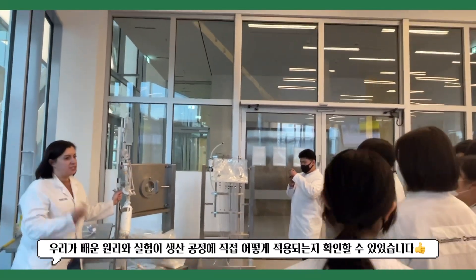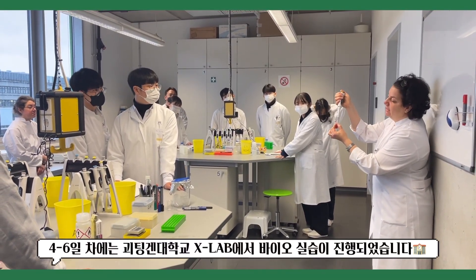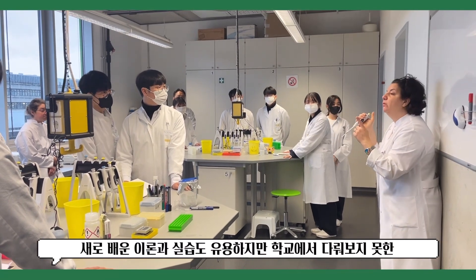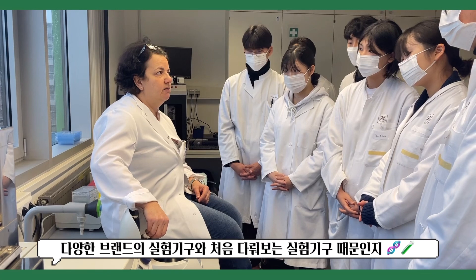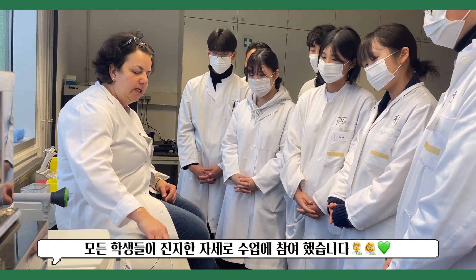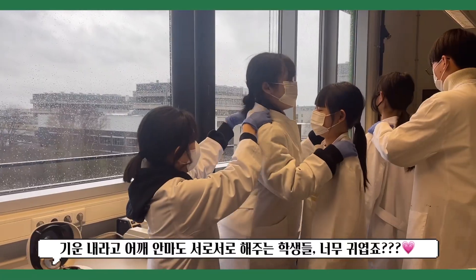After upstream we have the downstream and then you can release the liquid again. So these tips are also one way — we use them once. Then close the lid carefully and here you can make the settings; it's always in the protocol, how much and how much.